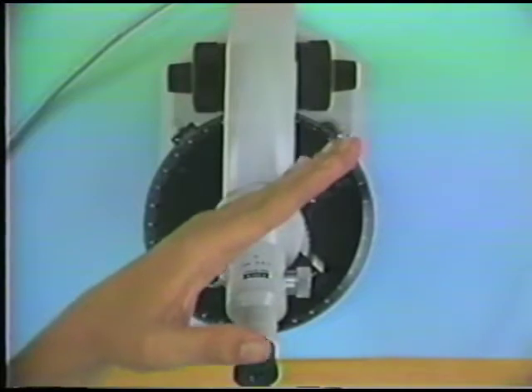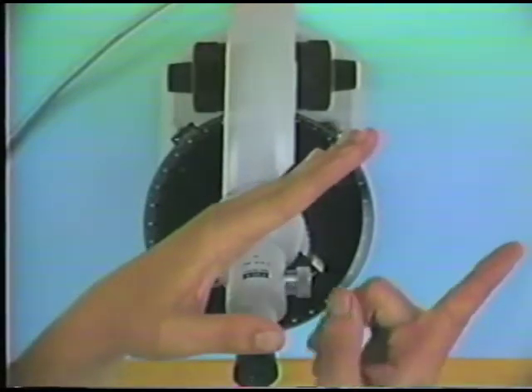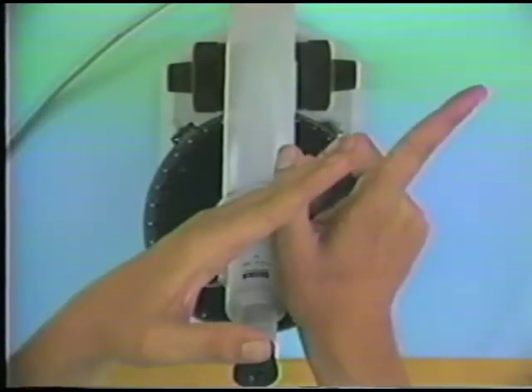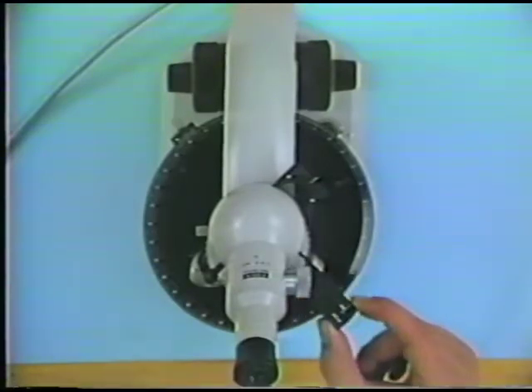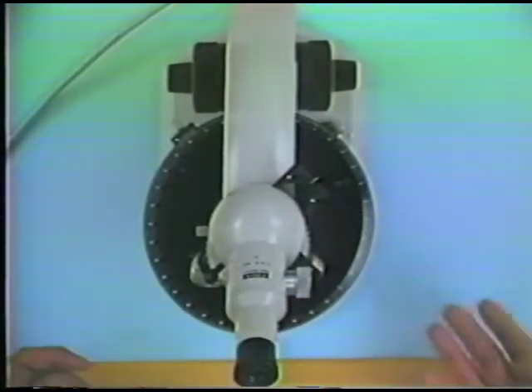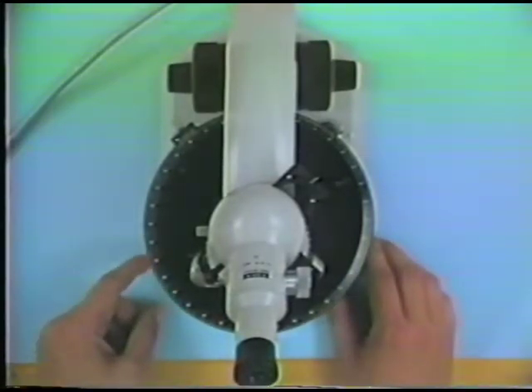And so for those quartz grains in the thin section that now show higher order interference colors, we know that their slow ray direction is parallel to the slow ray in the accessory plate. So the mica plate we can use as a tool for locating the slow ray in any kind of mount, thin section or immersion oil mount.